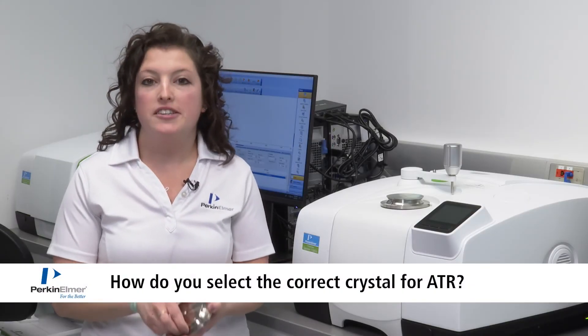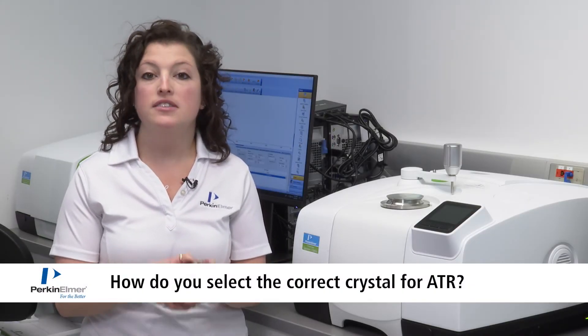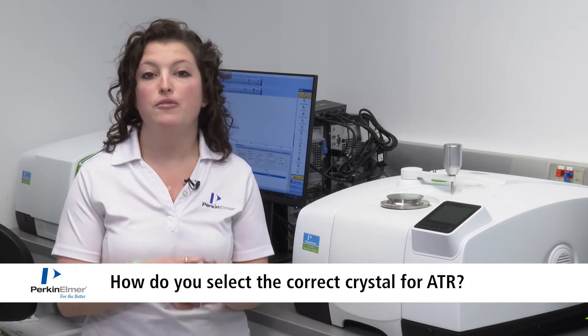You may wonder how to pick your ATR crystal material. This is going to depend on a few parameters of the material. One is going to be the spectral range. If you have material that absorbs in a lower region, you may want to consider which type of crystal material to pick to be able to obtain that lower region.